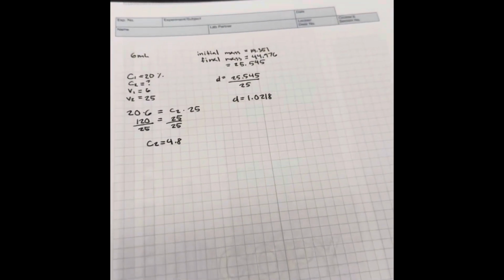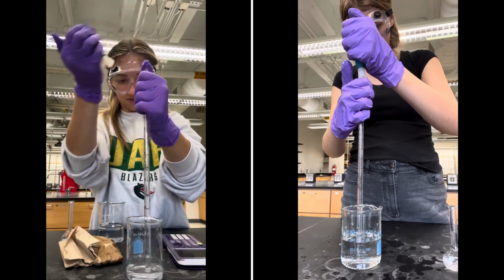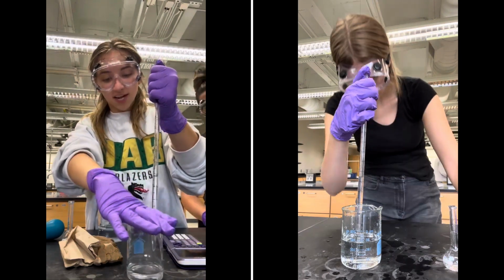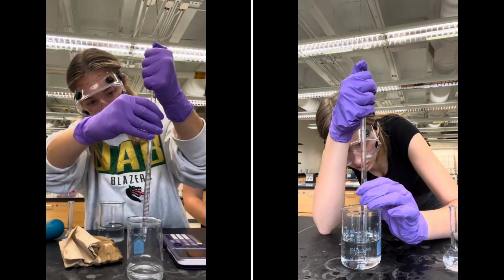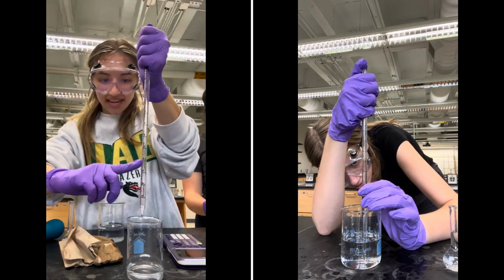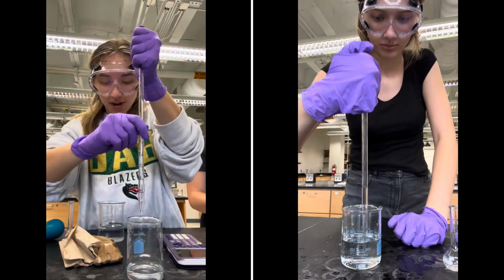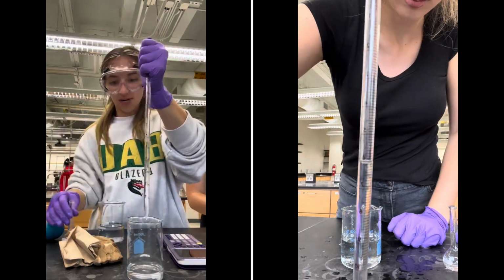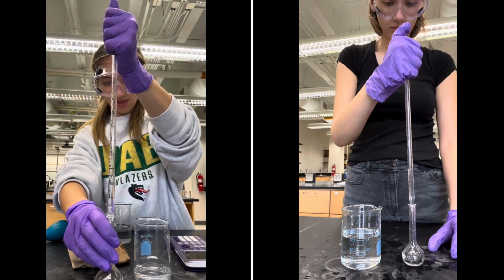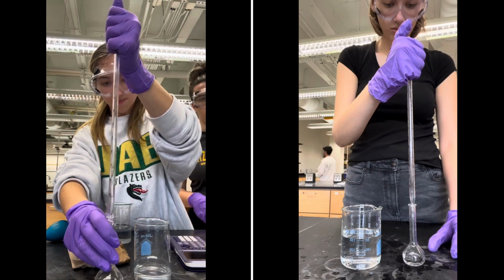So now on to trial 2. Find the slope of the line. But that's challenge 2. Right. You have to do challenge 2. Okay, and now I'm going to get 4 milliliters of our diluted solution to pour into our flask. Wait, again, did you have to make the unknown solution? Yes, it's at 6, but we have 1, 2, 3, 4. Okay, that's what this is. Yeah, you need the meniscus right at the 6, just like we want. Okay, and I have the density of the solution. Well, we'll do that when she's done.